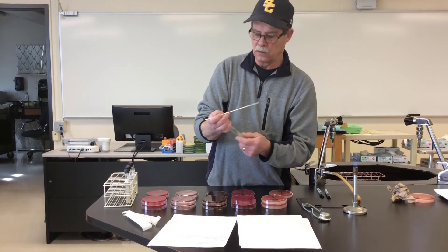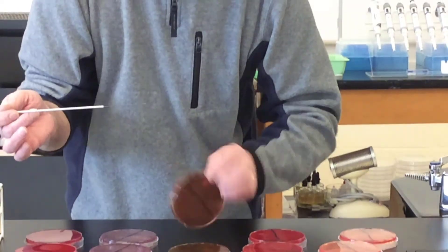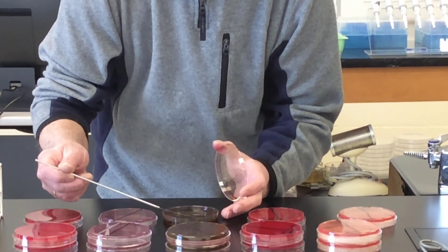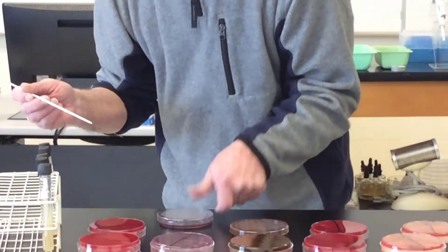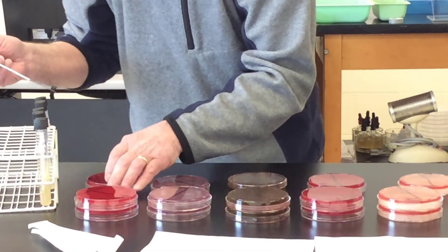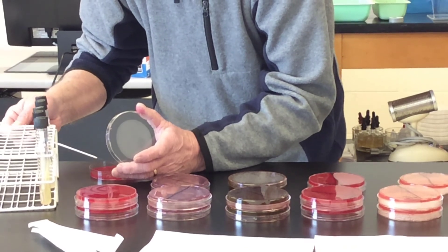We have more than enough on there. Now on to EMB — again, all we're going to do is a straight line. And I'm going to continue on this blood agar. I have more than enough inoculum on there.